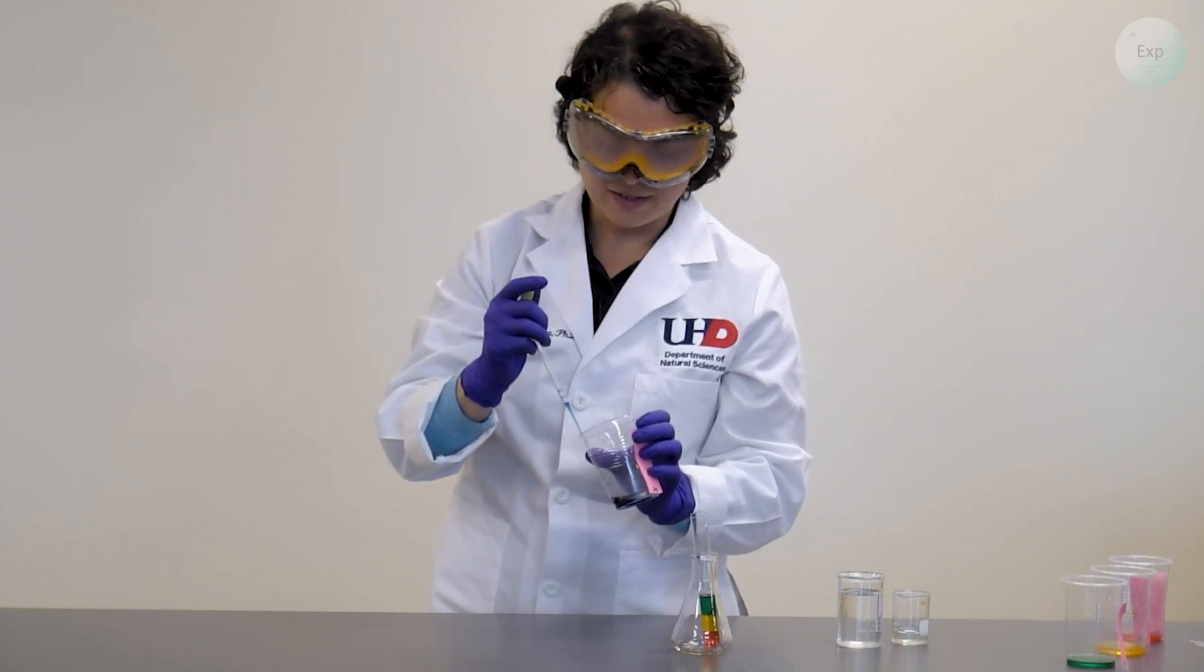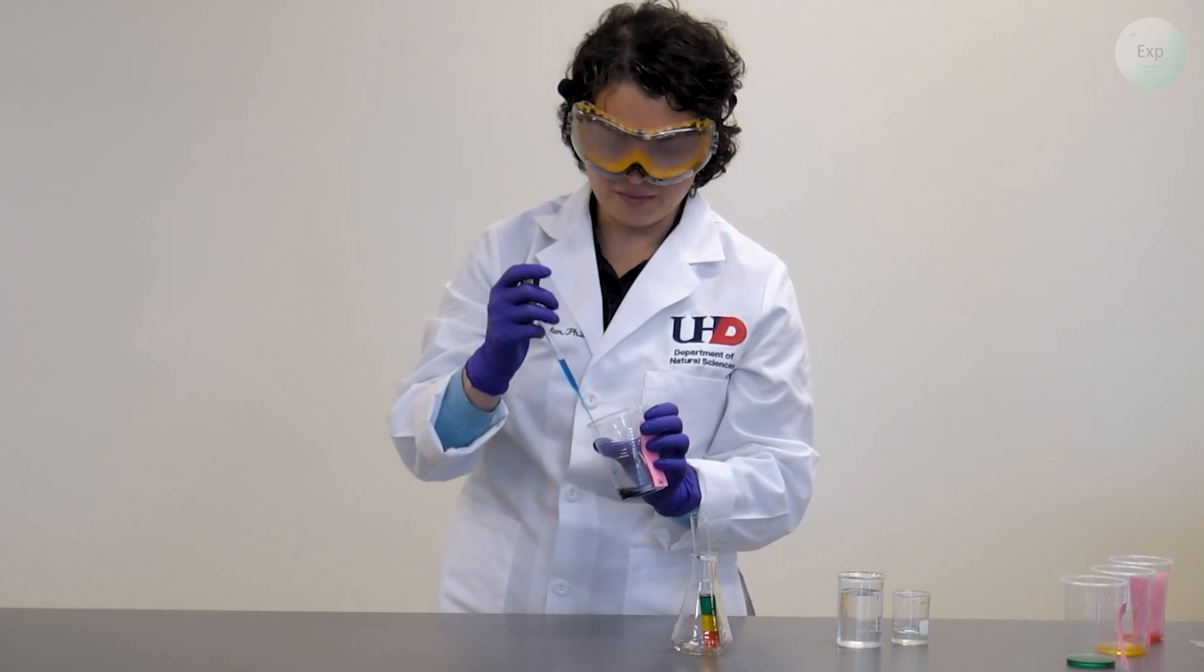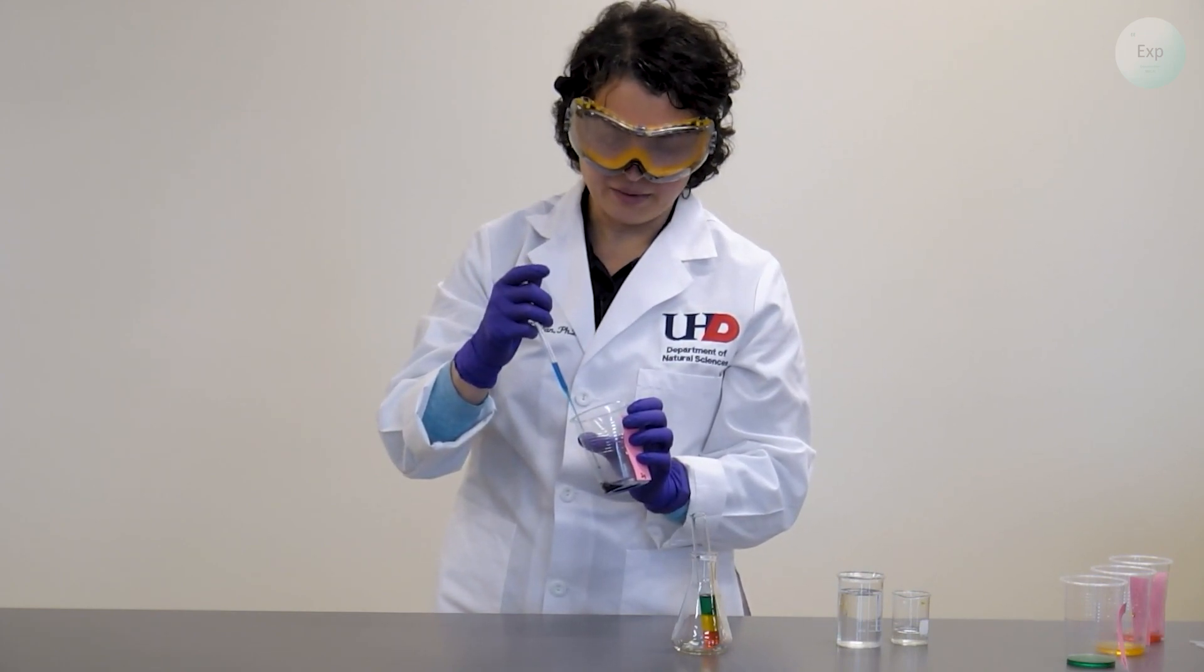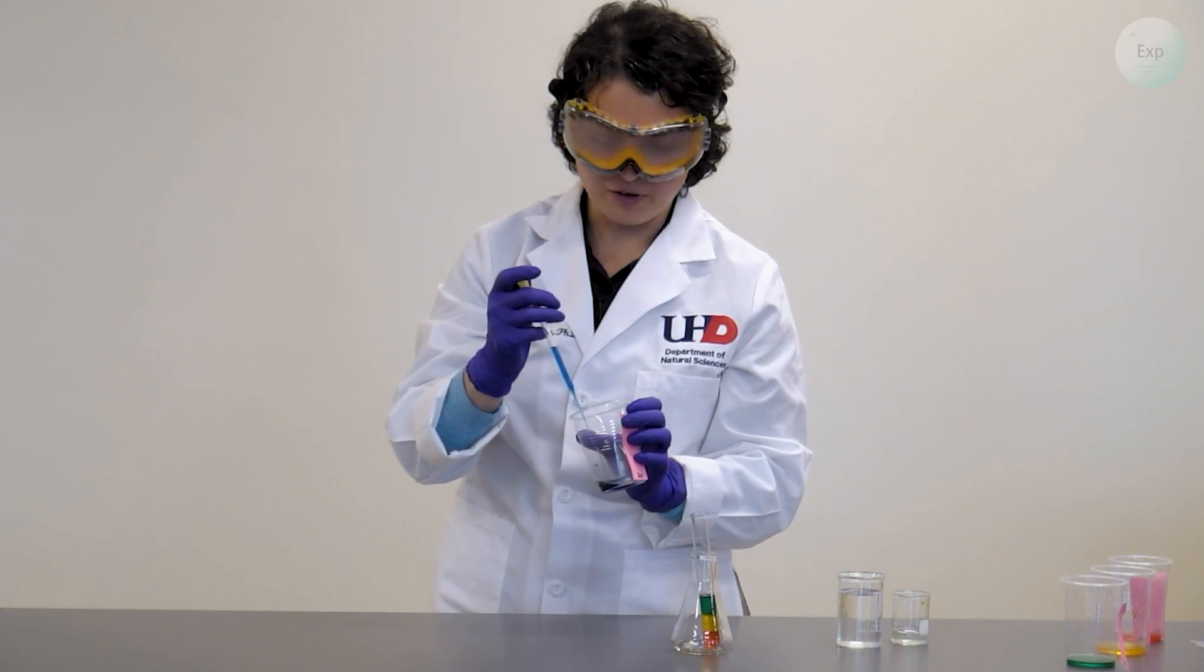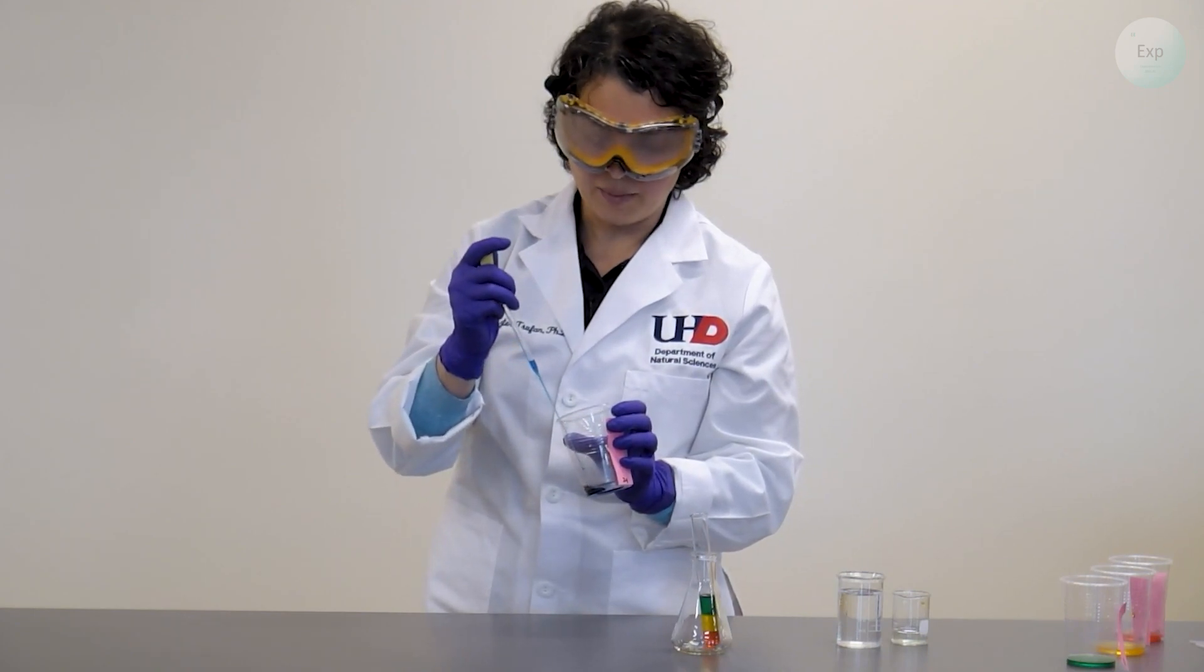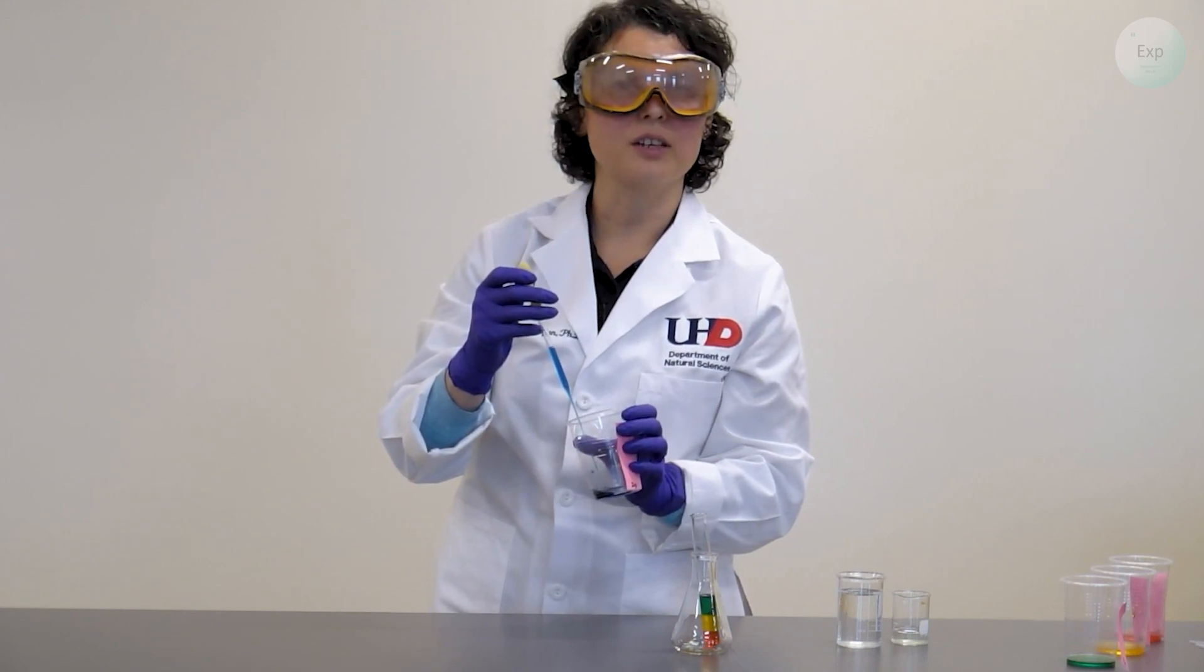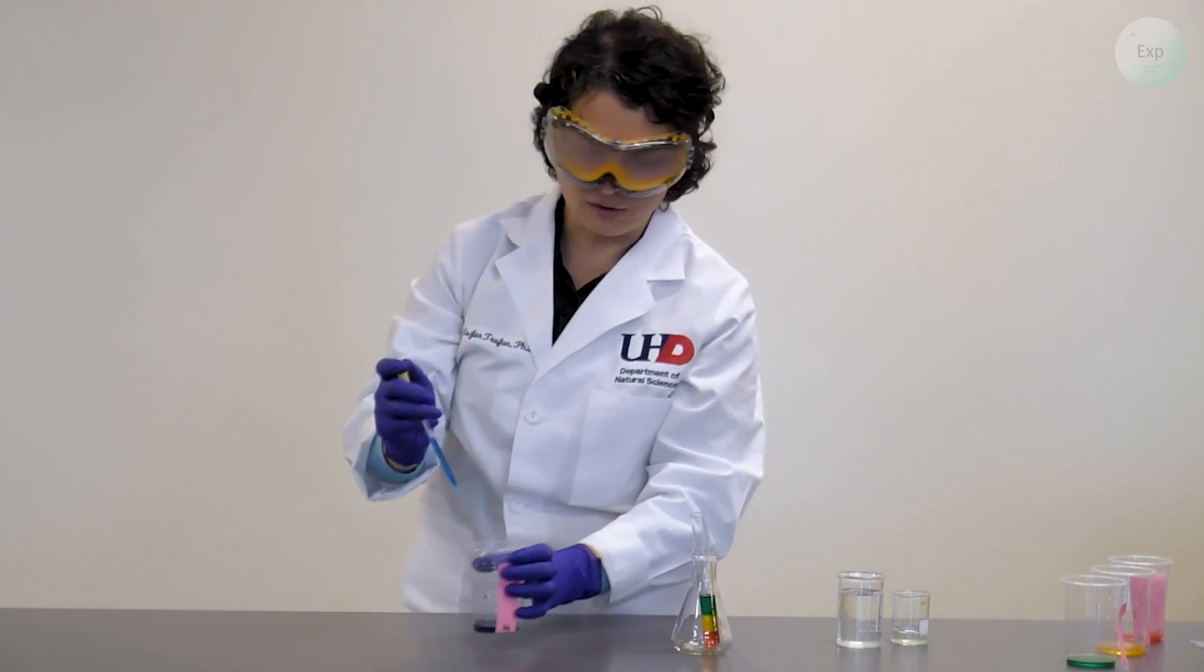We rinse it again a couple times, and when we feel that we have a good sense for the behavior of this solution, we draw up a sufficiently large amount and then carefully begin the layering of our final blue solution.